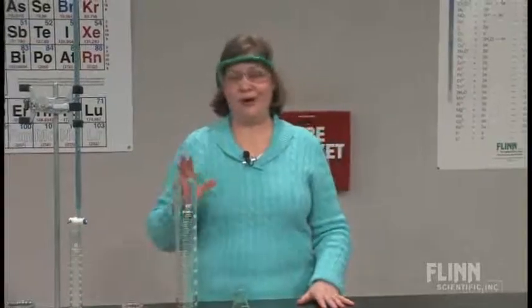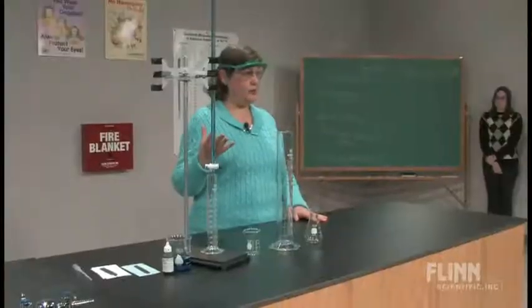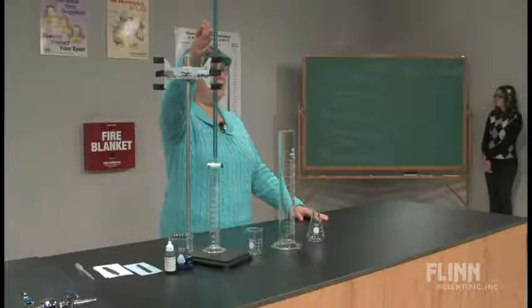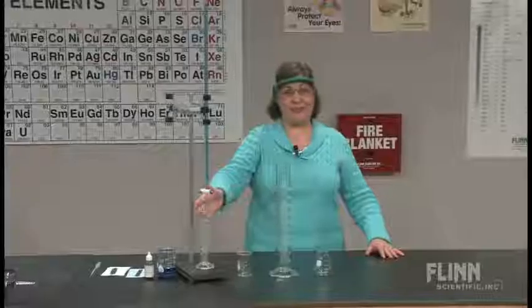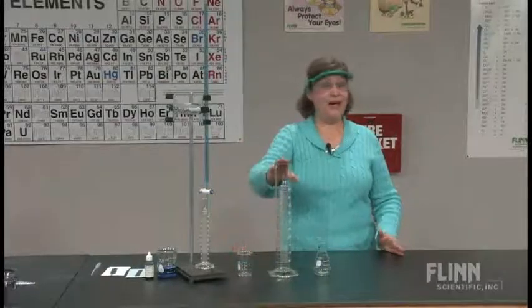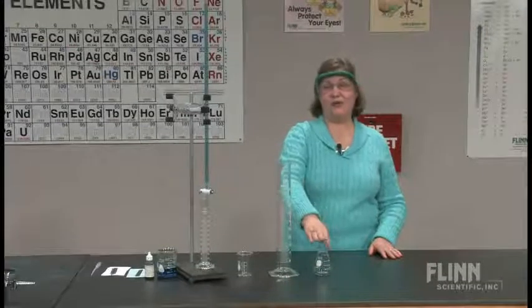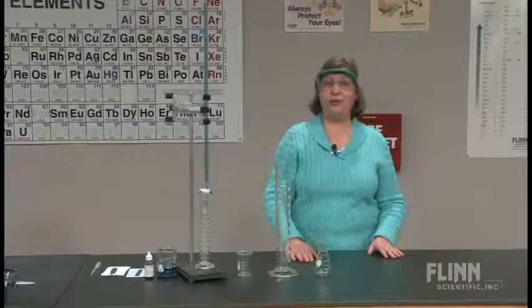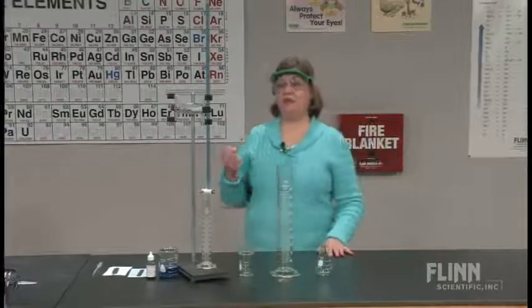What I've set up here are 5 different types of laboratory glassware, volumetric glassware that we would use to measure volumes. I've got a burette, a 50 milliliter burette. I've got a 100 milliliter graduated cylinder, a 100 milliliter beaker, a 500 milliliter graduated cylinder, and 125 milliliter Erlenmeyer flask. And they're all going to give us different readings. We need to learn how to read measurements and in particular volumes.